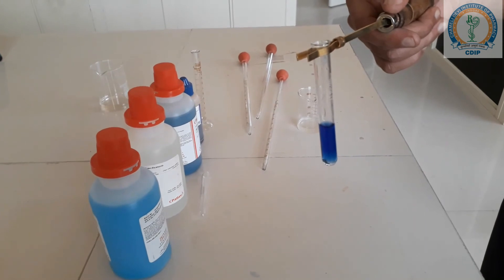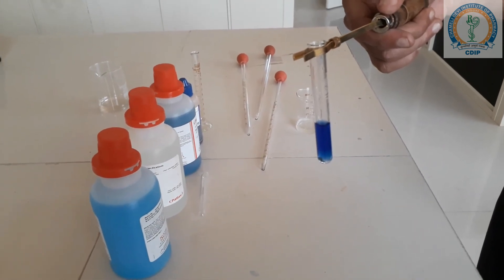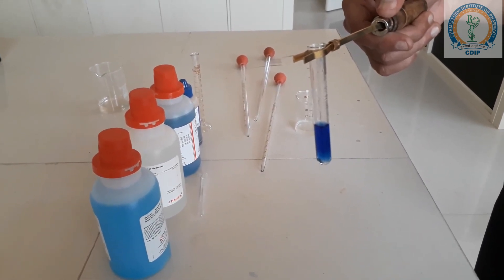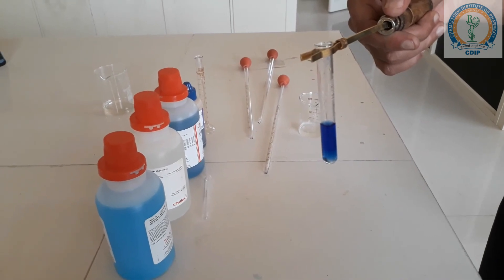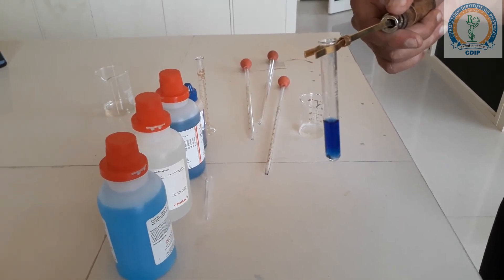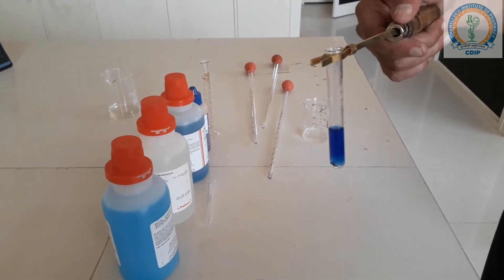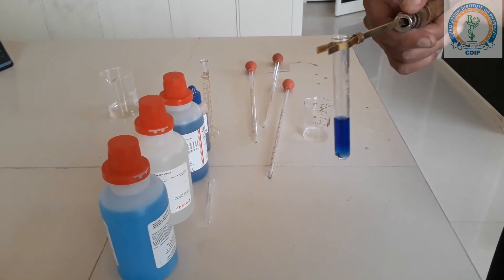For the test, we have taken 2 ml of Fehling's solution and added 2 to 4 drops of test solution.